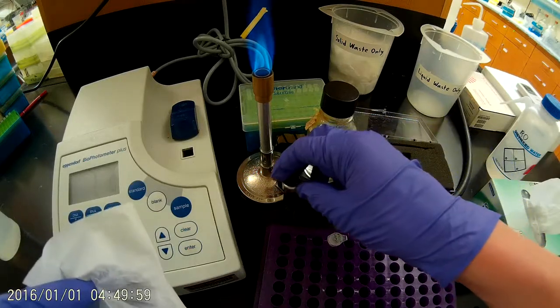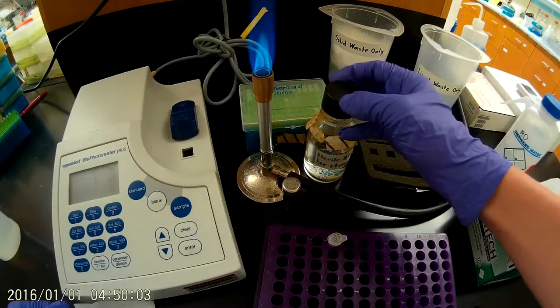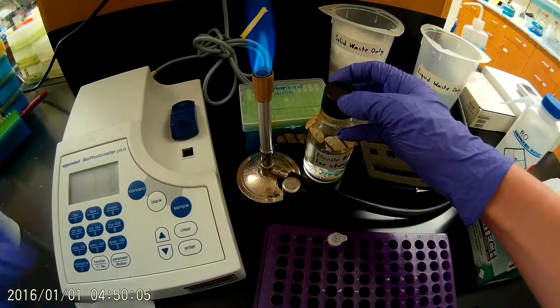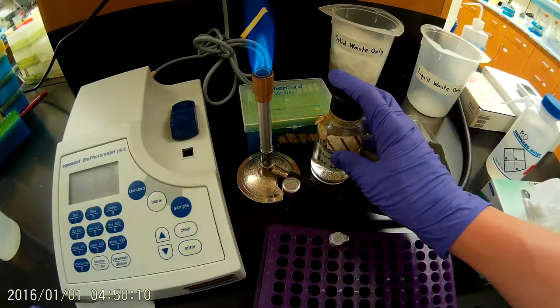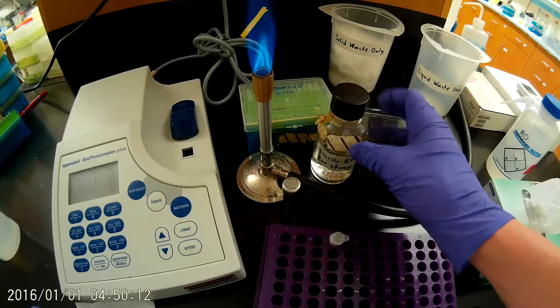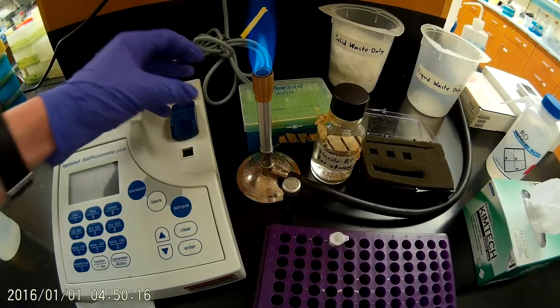Okay, so before we measure our DNA we need to blank it with water. Ideally you want to use the same water that you used to actually prepare your DNA sample. So that's what I have in this bottle here. You want to use nuclease-free water for this purpose. In our lab we use autoclaved milli-Q water and that should be good enough.